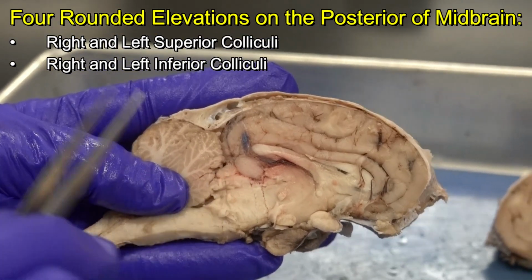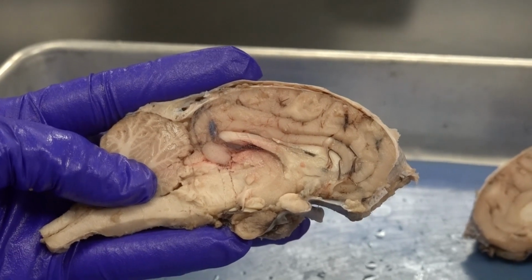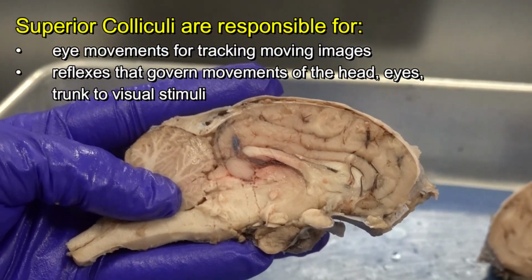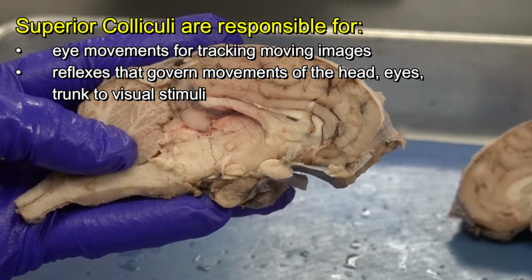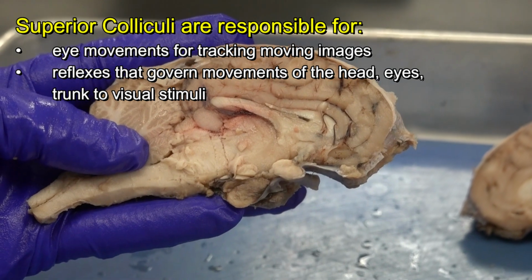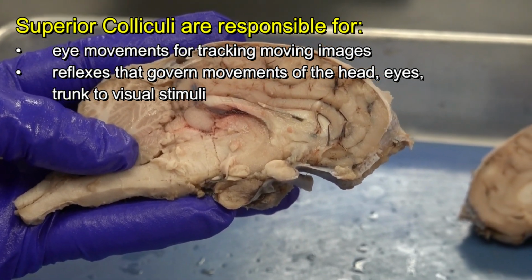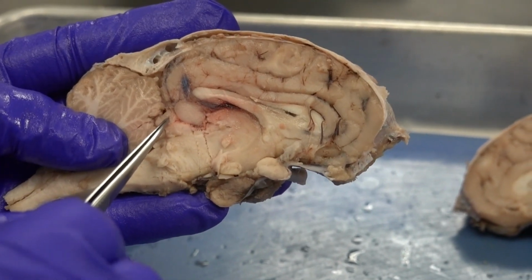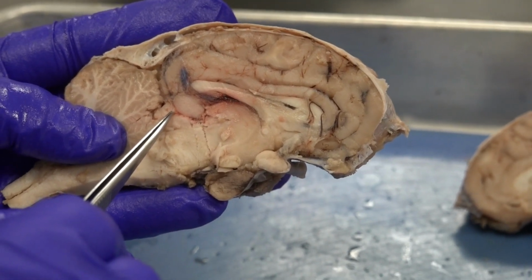The superior colliculi, we have 2 or a pair. They have neurons that control reflexes that we have to visual stimuli. When we say visual stimuli, for example, by moving your eyes, you track a moving object like a car or somebody passing by, or you're having the scanning movement of your eyes to read a sentence. So that would be one of the things that the superior colliculi do. Recall that they are located on the posterior of the midbrain.